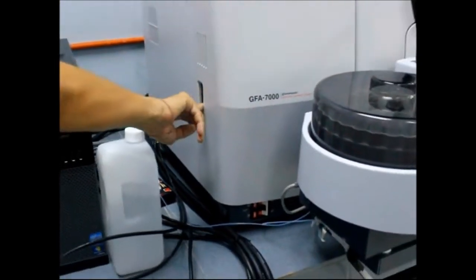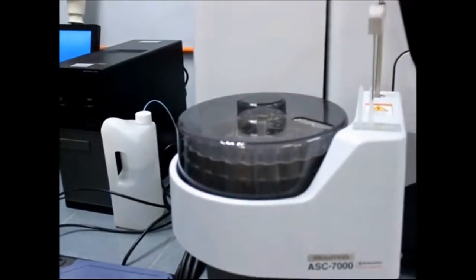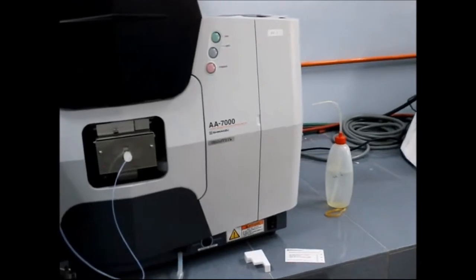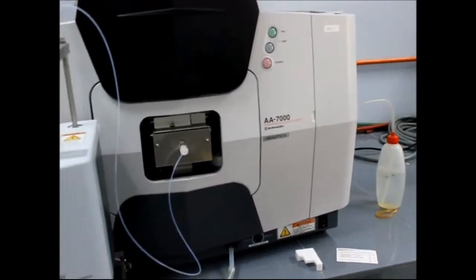Here. Can you show one there? One and this one. Okay. And then the generator and also air. And also at the end, the fume hood, fuel also. That's all. Is there any proper sequence we must use? Software first, then hardware. That's all.